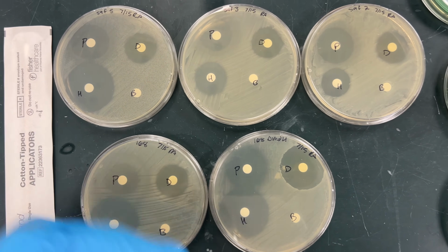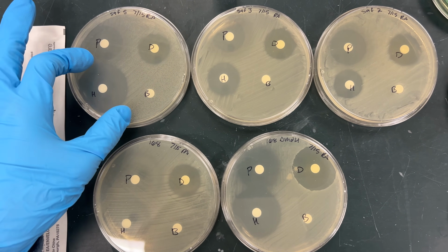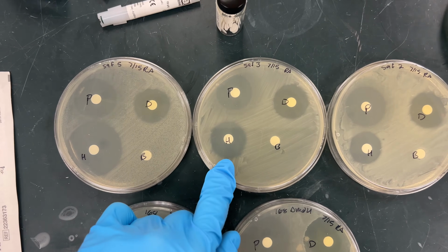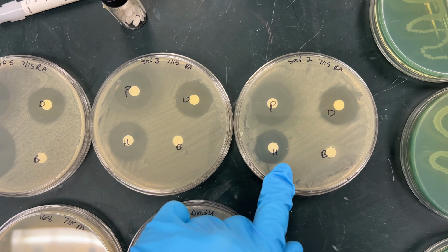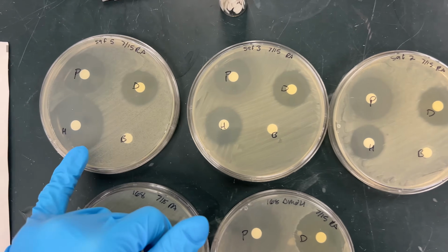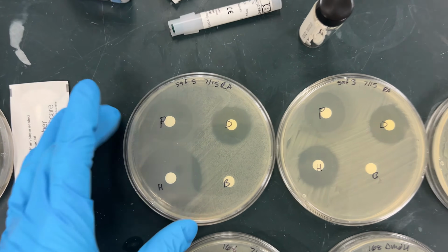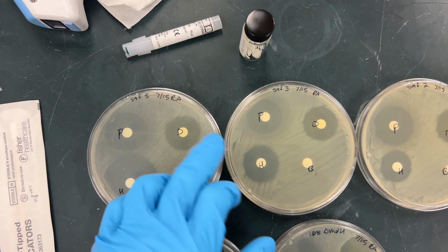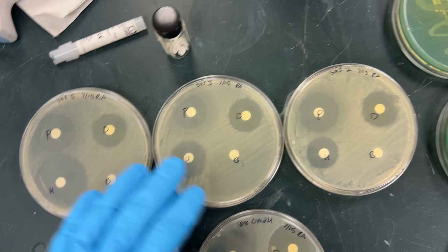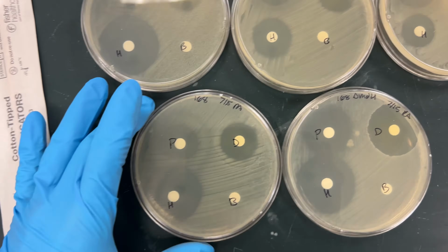So, for example, we can see that this one is H, so this was hydrogen peroxide. We see a bigger zone of inhibition here than we do if we look at this bacterial plate, and we see an even smaller one when we go to this one. So we would say that this one is most resistant to the hydrogen peroxide, and this one is the least resistant. But they have similar abilities to resist the diamide, which is another oxidative stress generator, and fairly similar with the paraquat, which is like an herbicide or something like that.